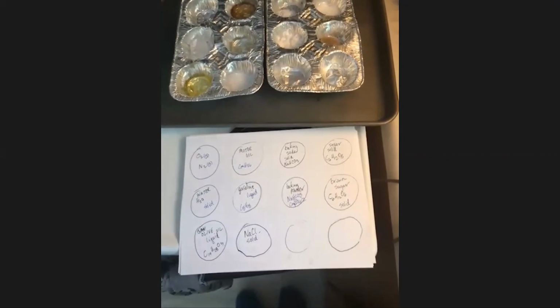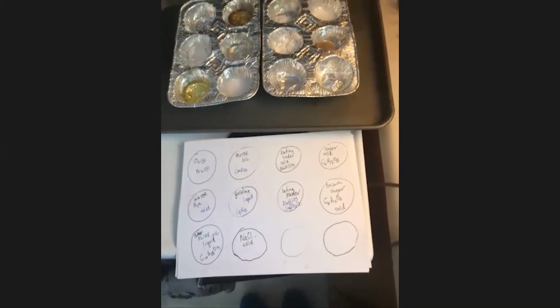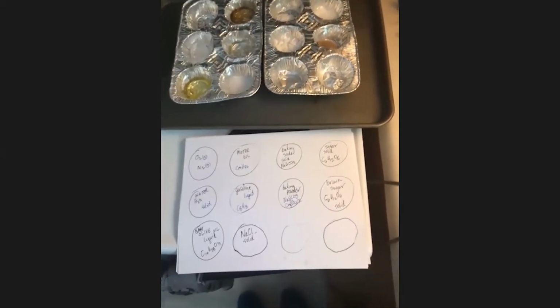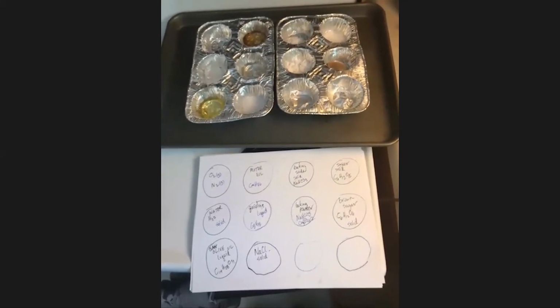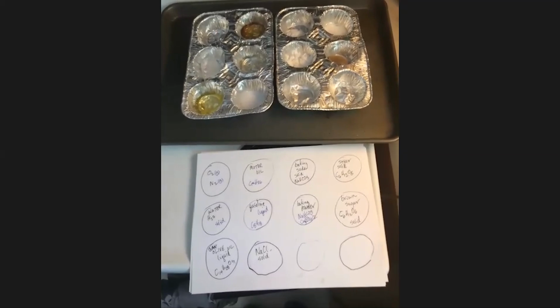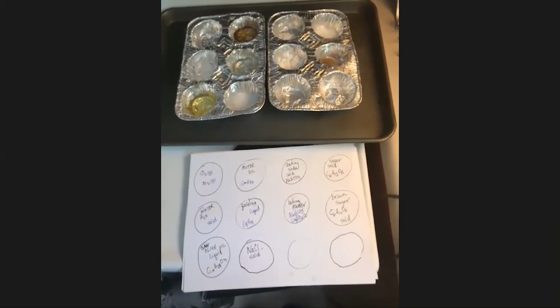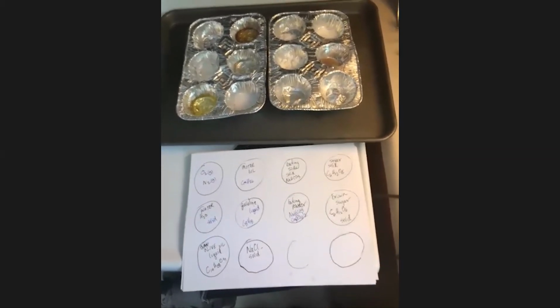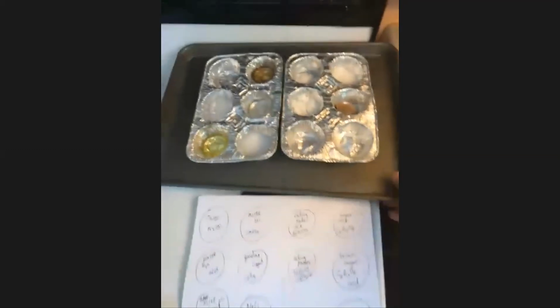Are we still talking about the phases, and then we're going to try to interpret what that means in terms of the intermolecular forces. So then you would look at liquid, from gas to liquid, right? Yep. And we have four substances, I believe, that are liquid currently.